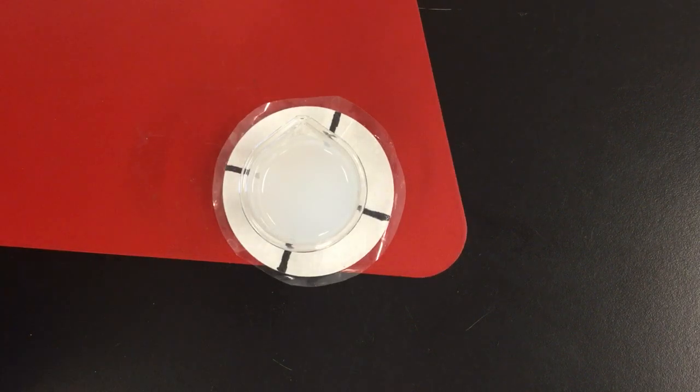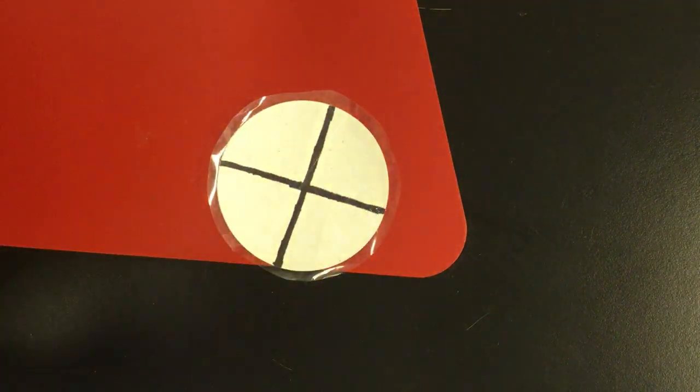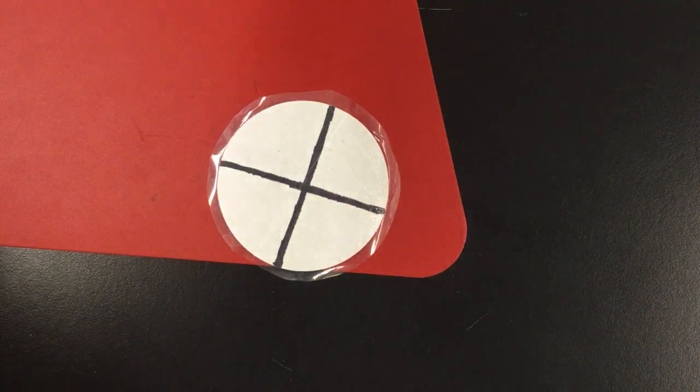Okay, that definitely looks pretty good to me. So I think that you should have stopped your timer before when I just took it off.